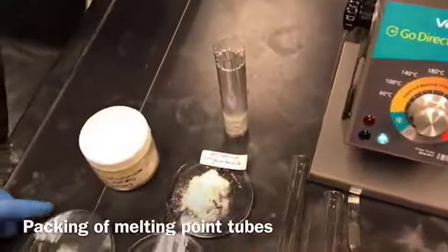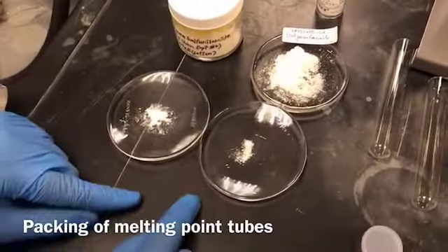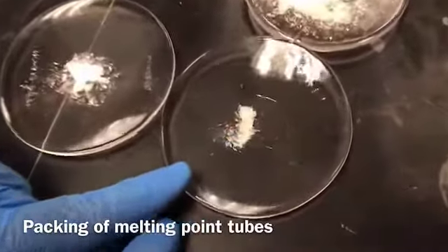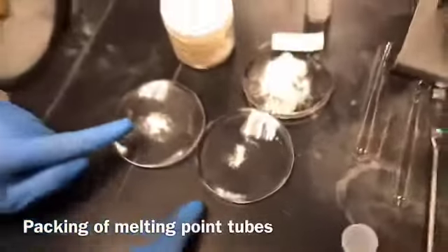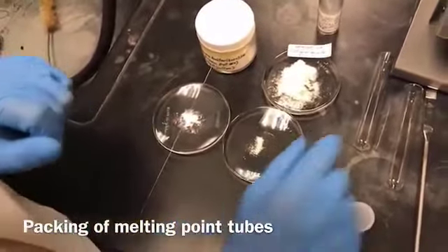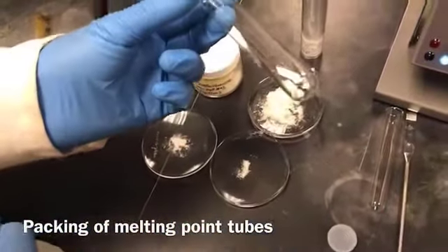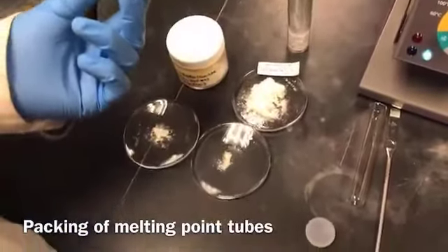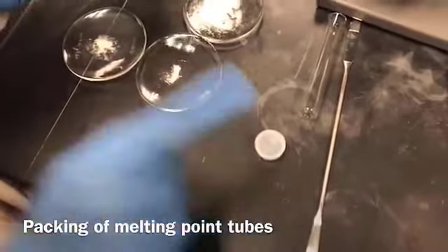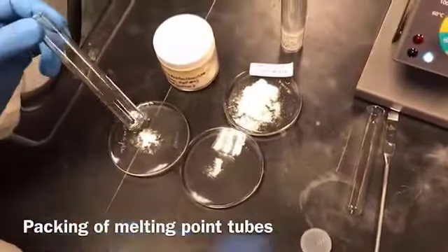Now when you fill the sample, make sure your sample is even. As you can see, the crystals are not even, so we are going to make them into a powder form. And so is the impure sample. So we would use either the back side of the test tube, or you can use the spatula as well. But make sure everything is clean.